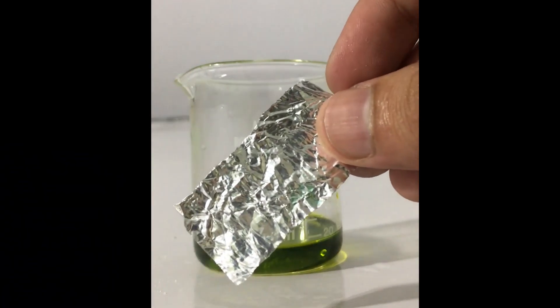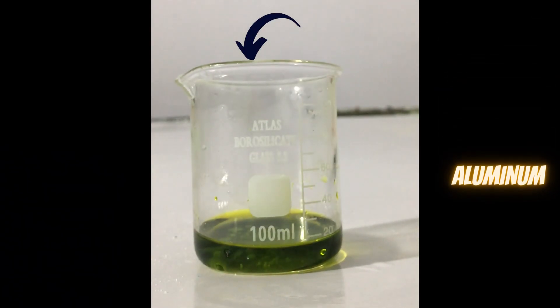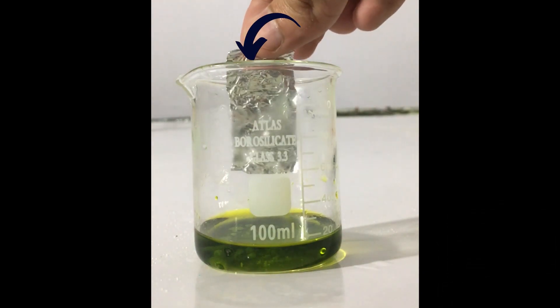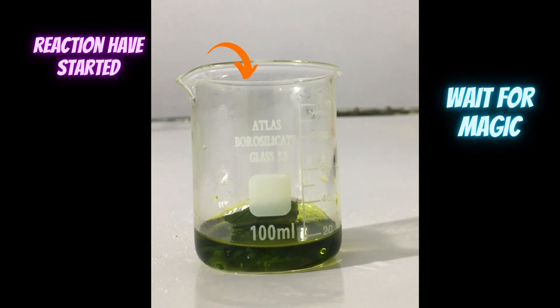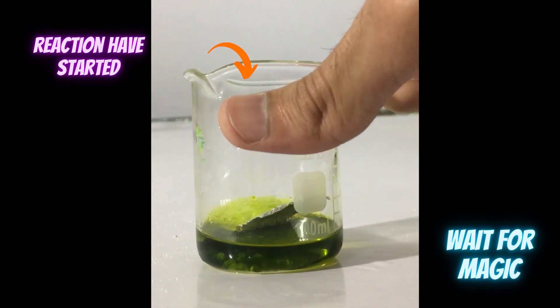This is an aluminum foil, and you have to introduce it in acid containing copper sulfate. You have to introduce a flame, and you will notice the release of hydrogen gas.